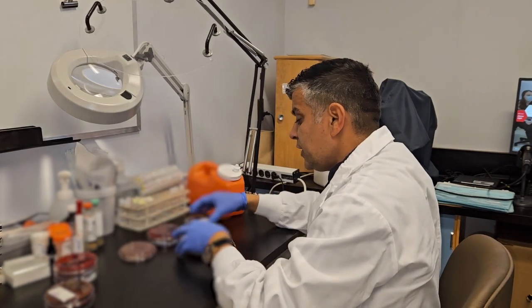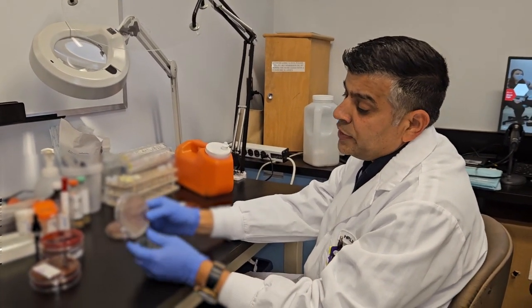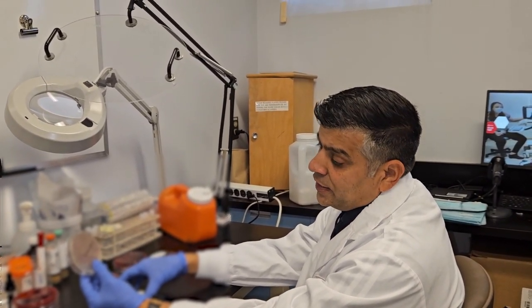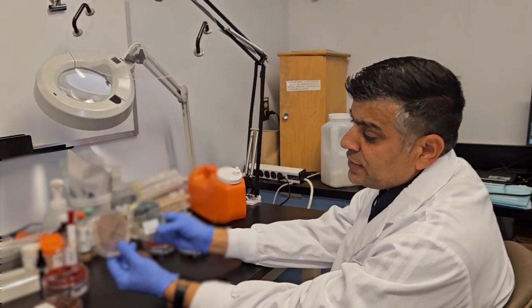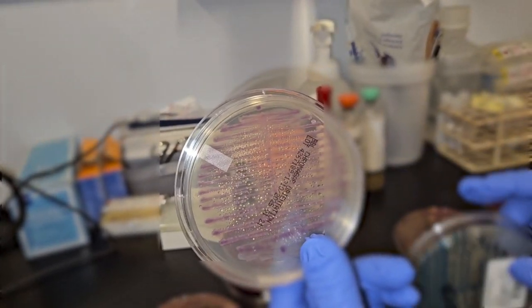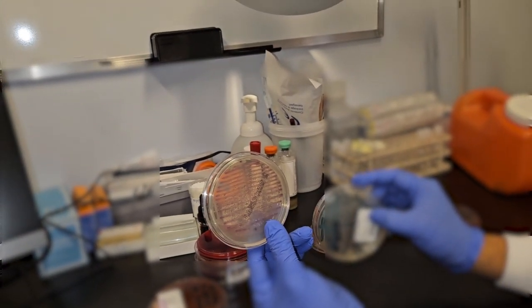There is another example of non-selective media, which is very popular these days. This is urine chromogenic agar. Urine chromogenic agar is non-selective media, but it performs a differential function. You can see on those 2 plates one dark rose colony. That's E. coli. That's how E. coli grows on chromogenic urine plates.